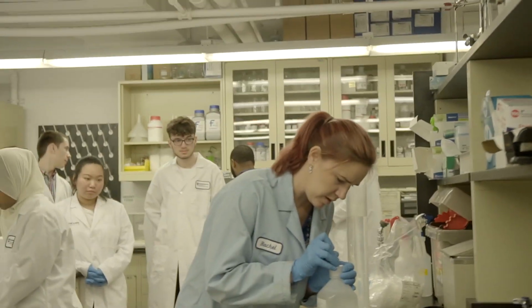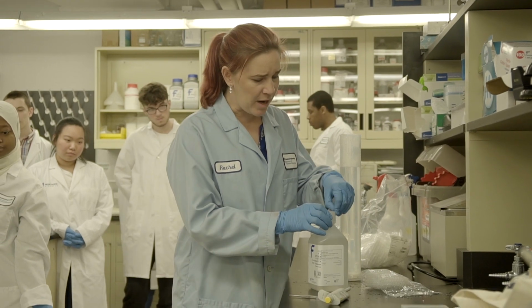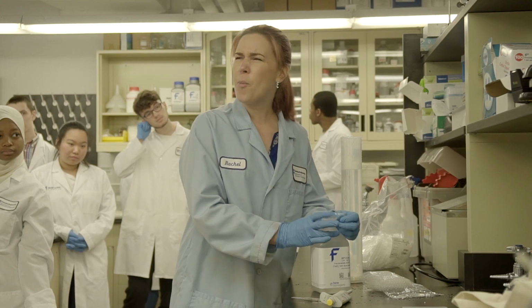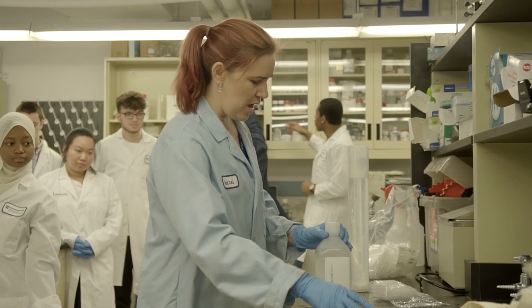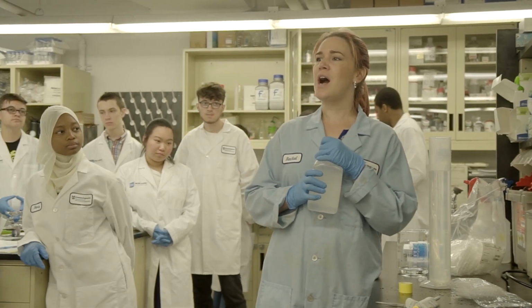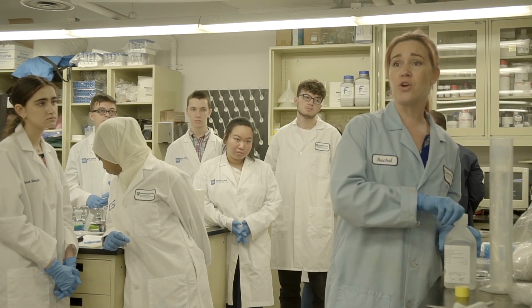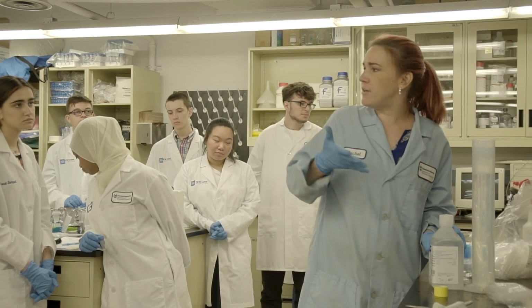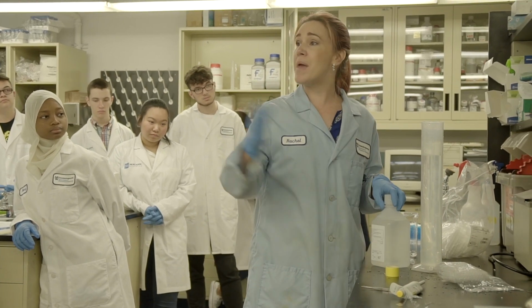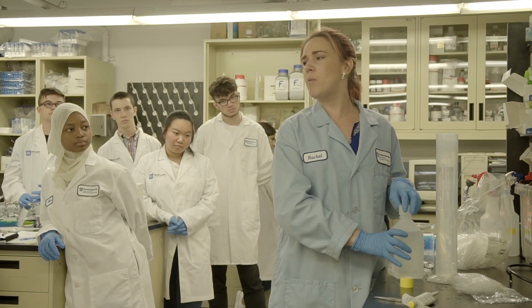So you weigh this out. So it's 1 gram. I got a really good question from my group about the restriction digest. So we all put it in at slightly different times. With restriction enzymes, they can only cut in very specific places. So once they've cut everything in your tube, they're inactive. They won't do anything else. So with restriction enzymes, it's very important that you do the minimum time so that you can cut everything. But if your reaction goes longer, that will be okay.